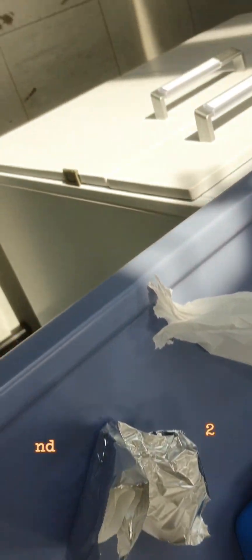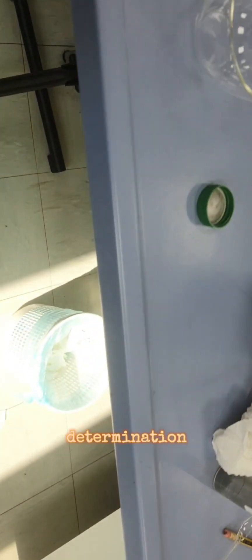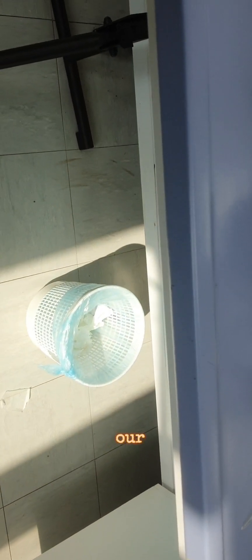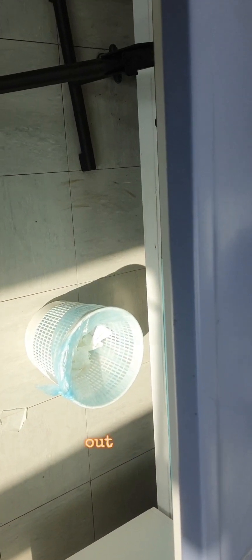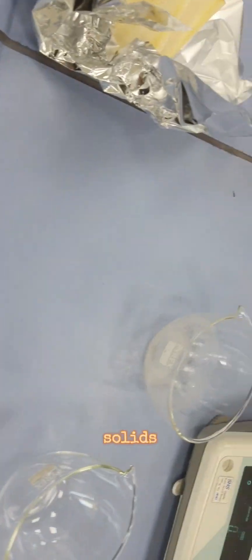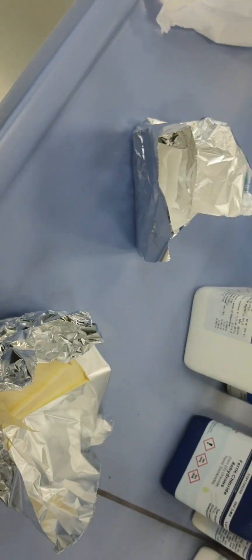Hello guys, now in our second part of the video about solids determination, our aim is to find out the volatile suspended solids and fixed suspended solids. I've taken two samples because our furnace is a bit small.